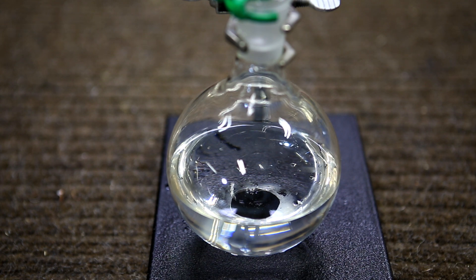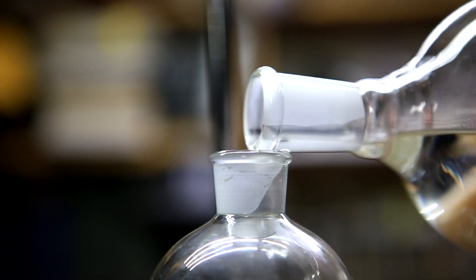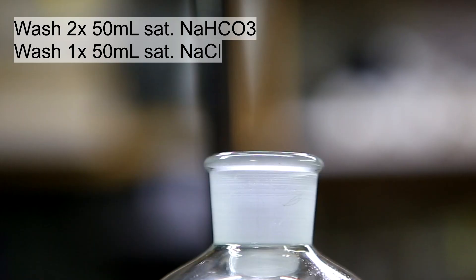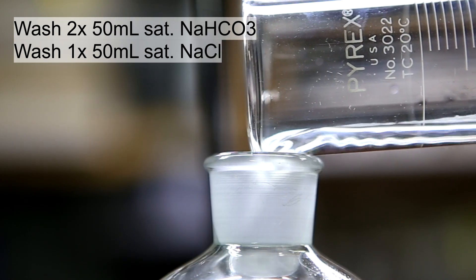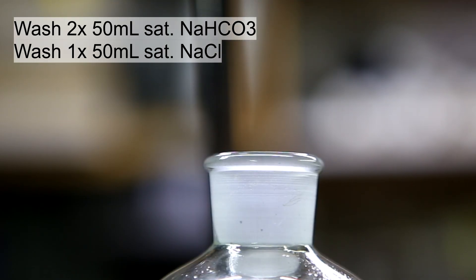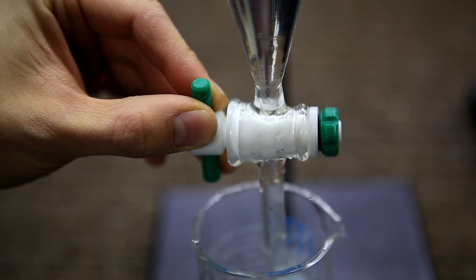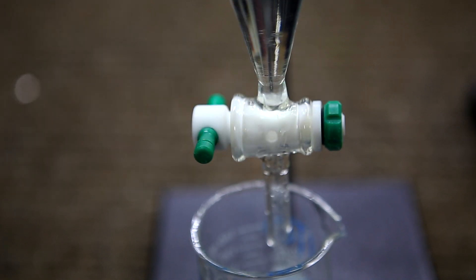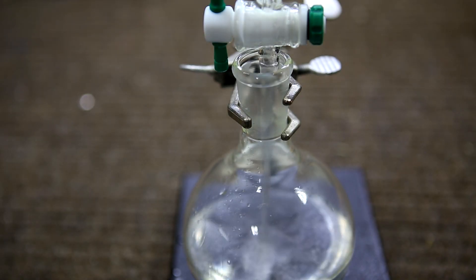If you use simple distillation, you'll likely have to wash with the sodium bicarbonate solution a few more times than I did. The crude ether was transferred to a separatory funnel. It was then washed twice with 50 ml of saturated sodium bicarbonate solution and once with saturated sodium chloride solution. For the sake of time, I don't actually show the washing step. Frequent venting is extremely important when doing the washing with sodium bicarbonate and with ether in general. After each washing, the lower aqueous layer is drained into a beaker. The washed ether is then transferred to a 500 ml round bottom flask.